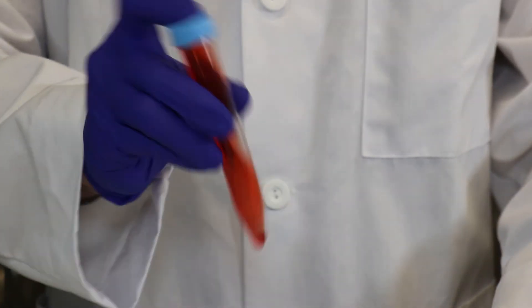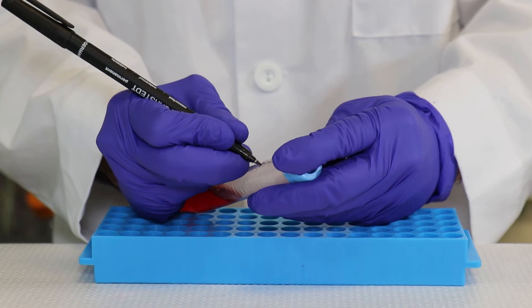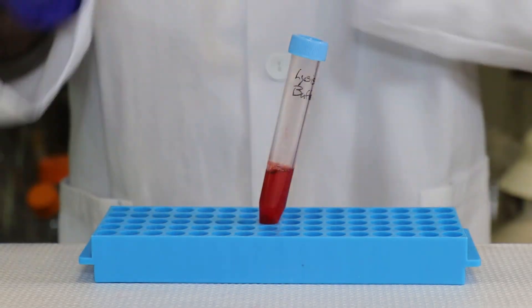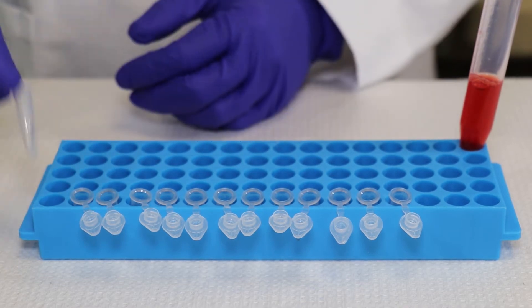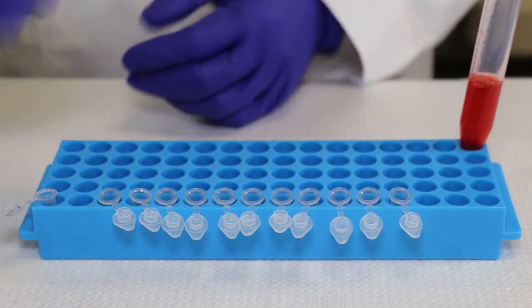Step 4: aliquot 300 microliters of lysis buffer into 13 labeled microcentrifuge tubes to be shared by student pairs.